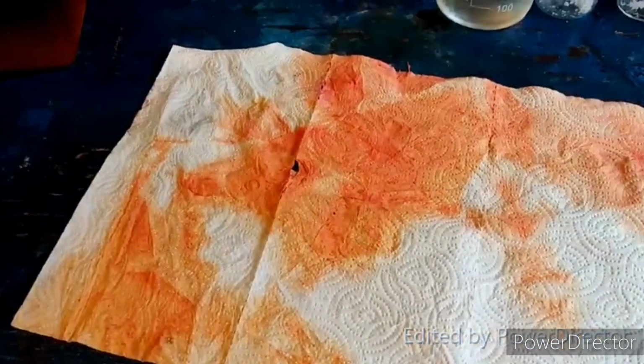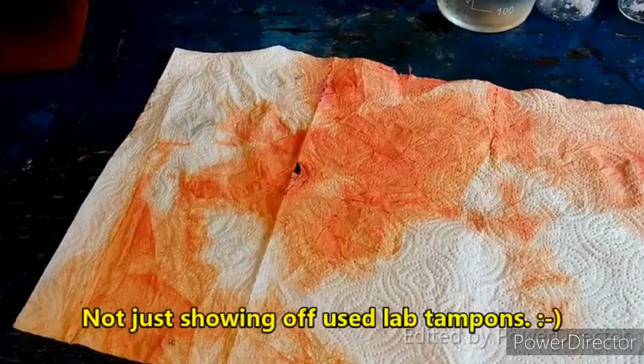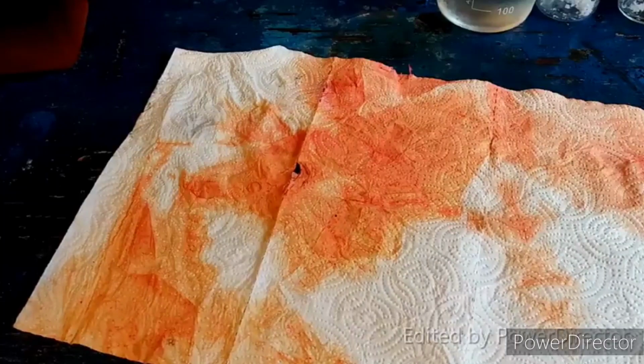That's also interesting because, you know, this is science, we seize all opportunities. This is the paper towel that I used to wipe it up with. Now, why am I showing you this? Well, after wiping it up, I hung it up and let it dry just to see how this stuff would do as a pigment if the dry powdered compound is mixed with water.